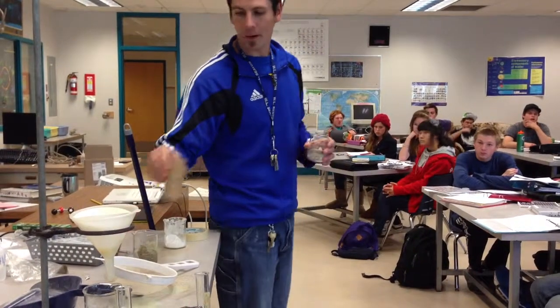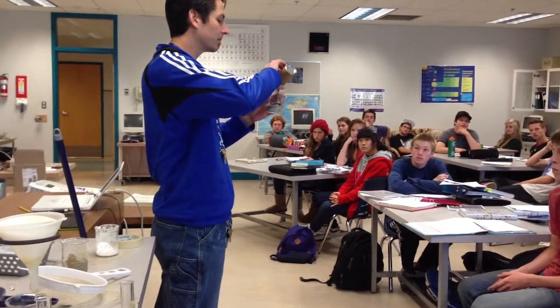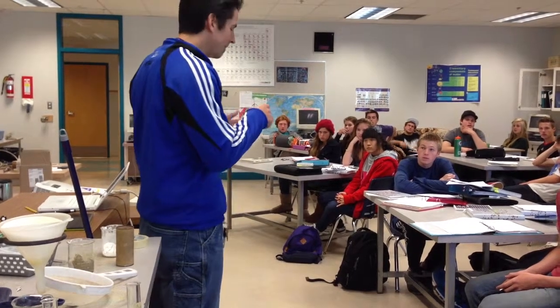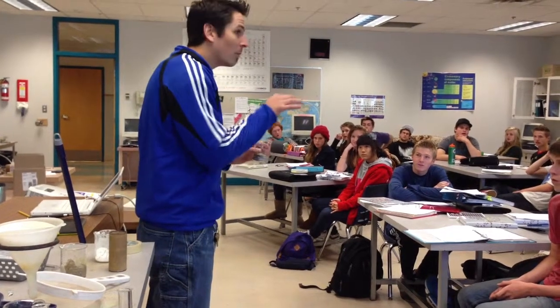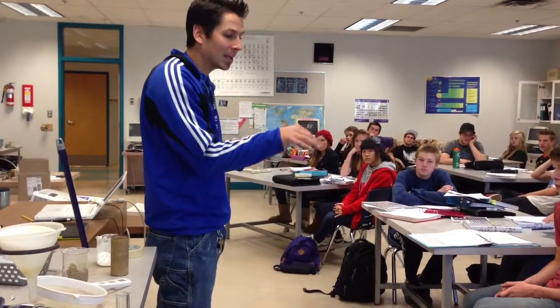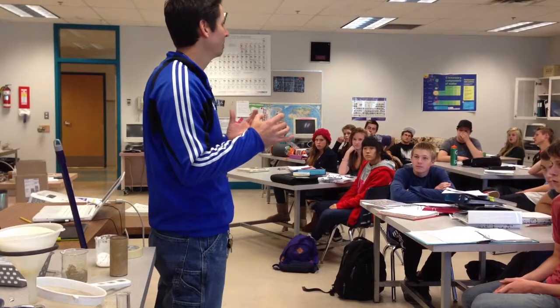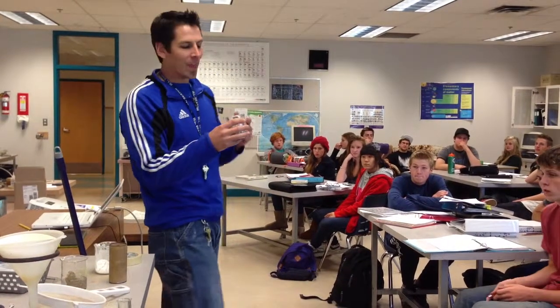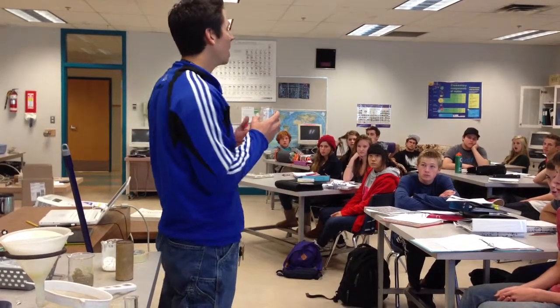We can take it a step further. Let's have the sand and the pebbles and some iron filings. Mix them up. Now, if I had no life, I could get a magnifying glass and a set of tweezers, and I could pull out by hand each sand grain, put it in one pile, and the iron filings, put them in another pile, and the gravel, and put it in another pile. Is that plausible? Like possible? Is it the best way to do it? No. There's another property I can use to separate the sand from the iron.